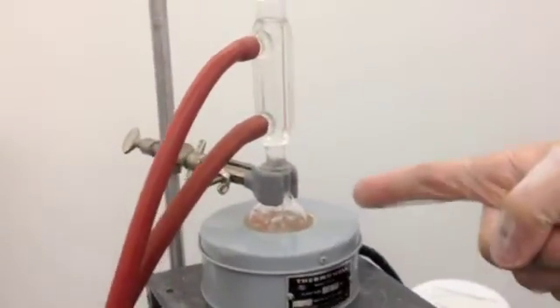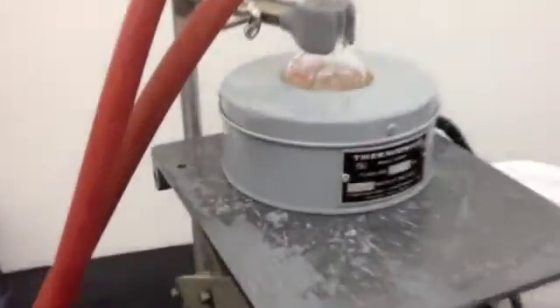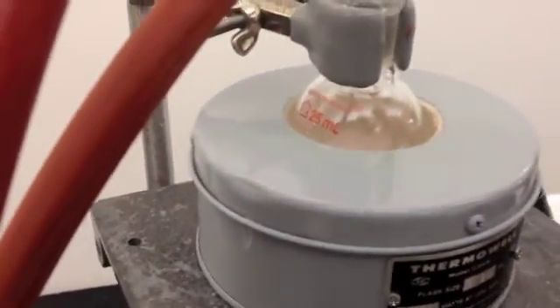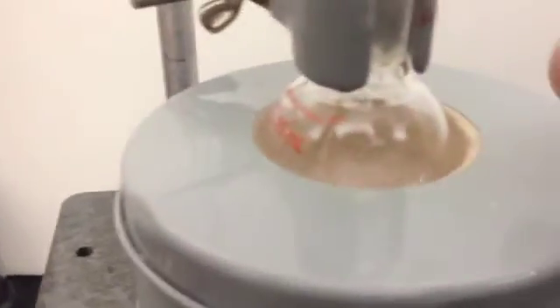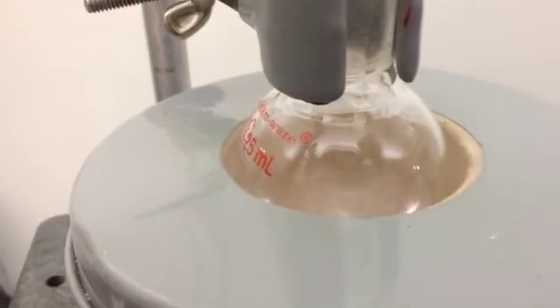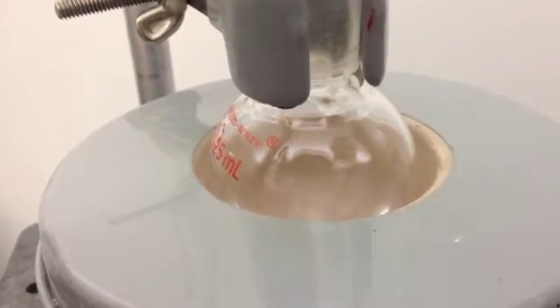Now that you see the gentle boiling going, you want to have one drop per second rate, which is what we have currently.